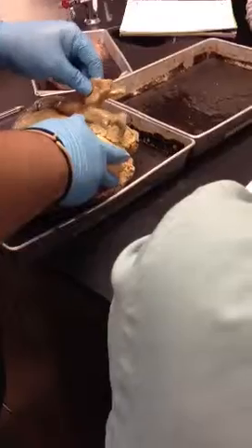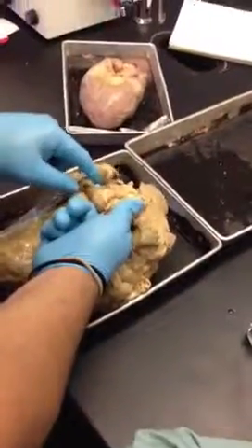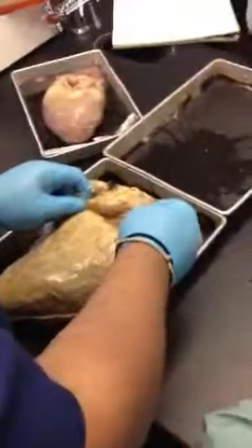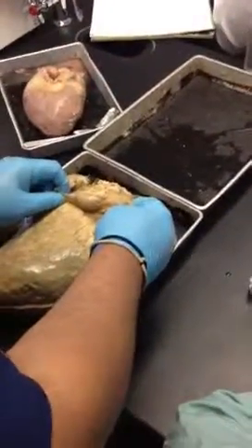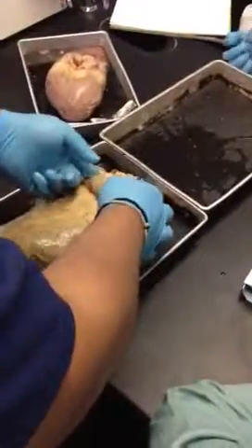This happens to be the superior vena cava, which means then if I turn the other direction, and I take my finger and I go downward, I should be able to find another opening, which I do, and sure enough, there's the inferior vena cava. So you can see they're very close to each other, okay? Not like the picture or the model, where it makes it seem like here's the superior and here's the inferior down here, as if separate structures. They're not. That's what I was telling you when we were going over this in class last week.